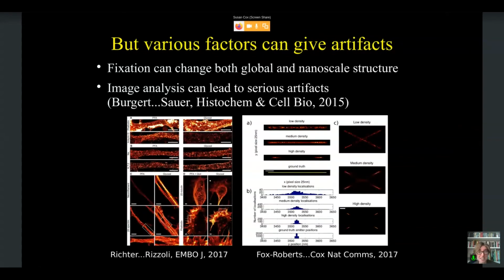Also, of course, the analysis can lead to a lot of artifacts, and that's something that I've obviously been bringing up throughout this talk. But here's a first example where I've just done a very simple simulation. We've done just a line and then a cross line at low density data where the fluorophores are all well separated, medium density data where we have a bit of overlap, and high density data where most of the fluorophores overlap.